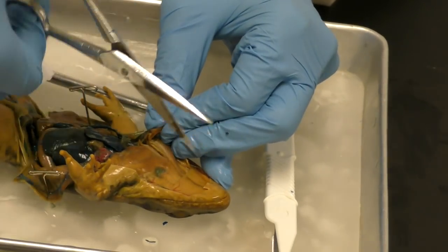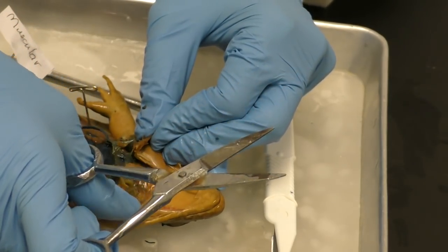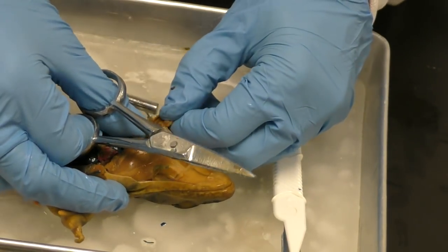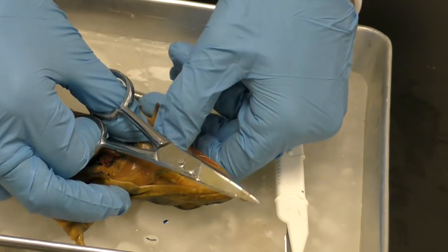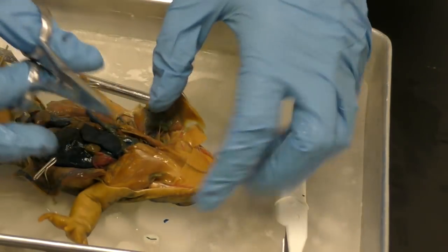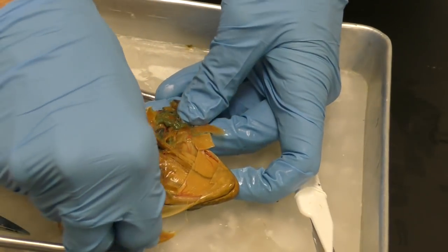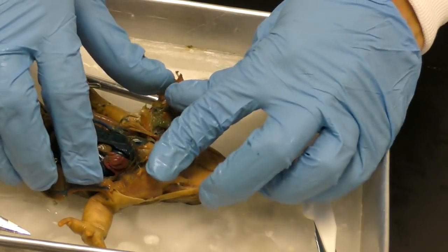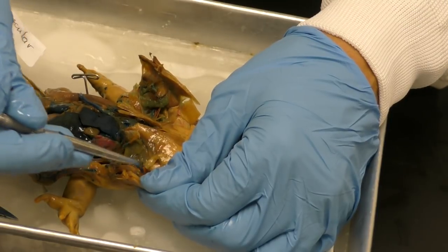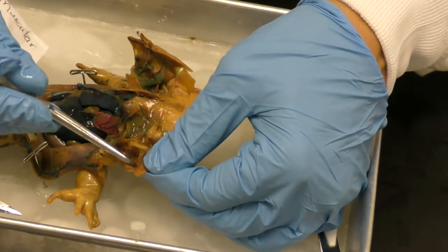Okay, can you hear that? It's really tough, and if you were here, you would be able to hear me breaking open this protective system. So this system provides support, it provides protection, and what it's protecting for us is our chest cavity. Okay, so I just broke open the ribs. Let me make sure that I didn't take an organ with it. Let me see if I can reveal the ribs here.